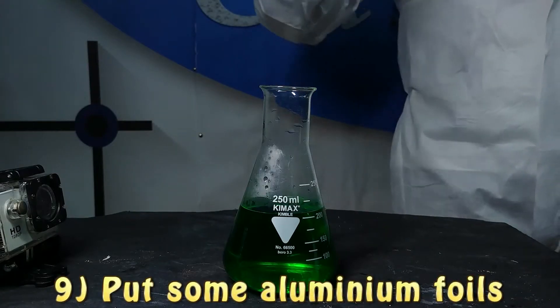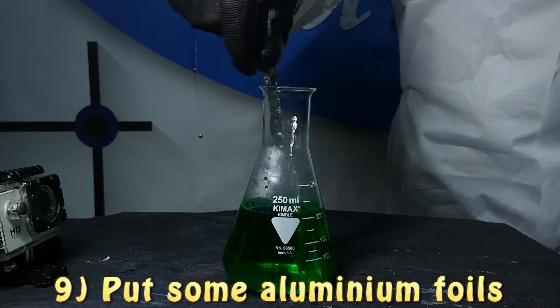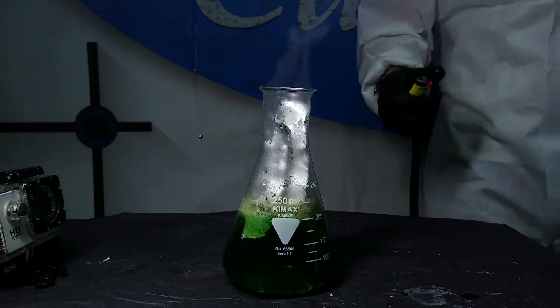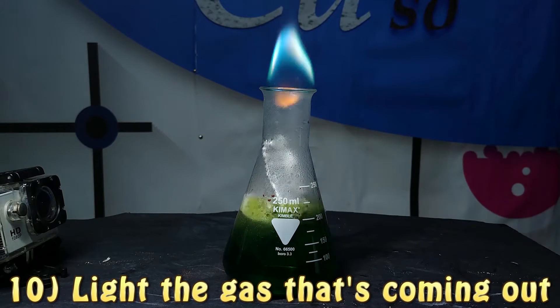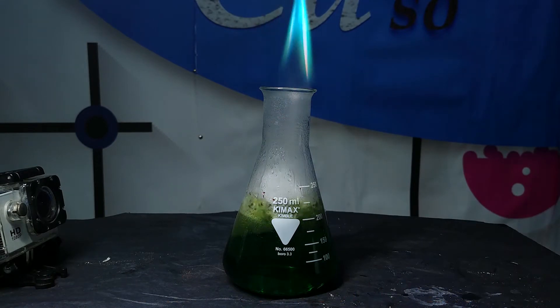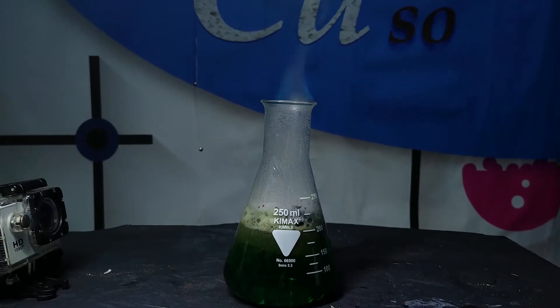The last part of the experiment, which is the most fascinating one, is to put into this conical flask — which contains our solution — some aluminum foil, which is our common tin foil. Then we are going to see this reaction from which a gas is freed, and we are going to ignite this gas with a lighter and see a beautiful flame.